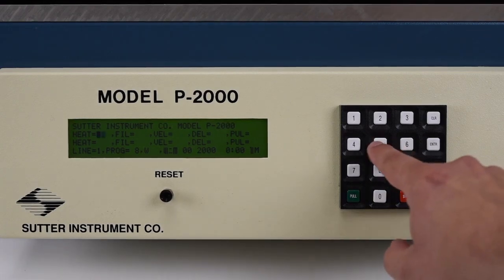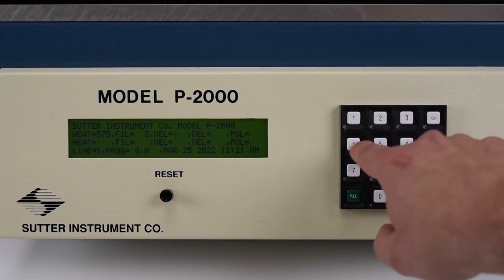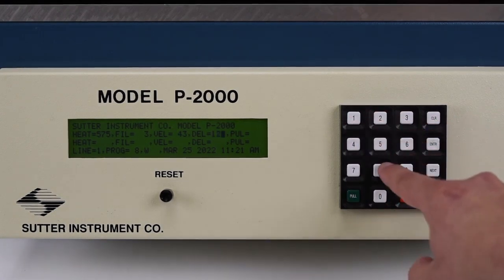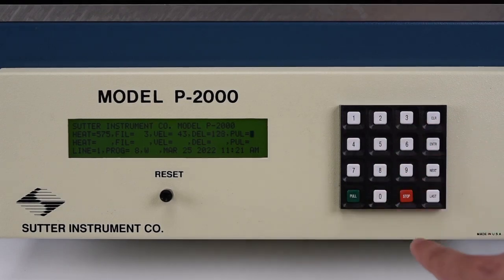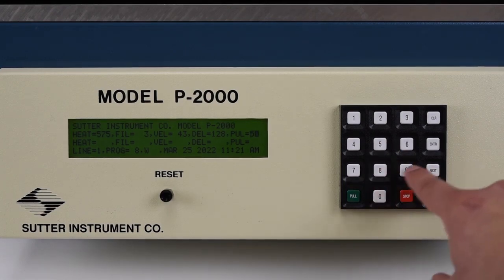Parameter spaces can be populated with values in either of 2 ways. First, entering 3 digits will fill a parameter space and advance to the next. For values less than 100, values can be loaded with leading zeros. Second, by entering fewer than 3 digits, followed by the Enter key. You can advance to the next parameter without changing the value of the current one by pressing Enter without entering any digits.